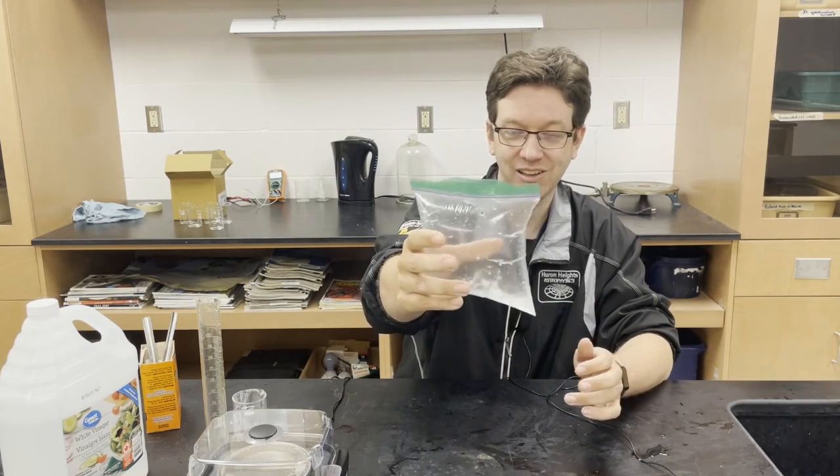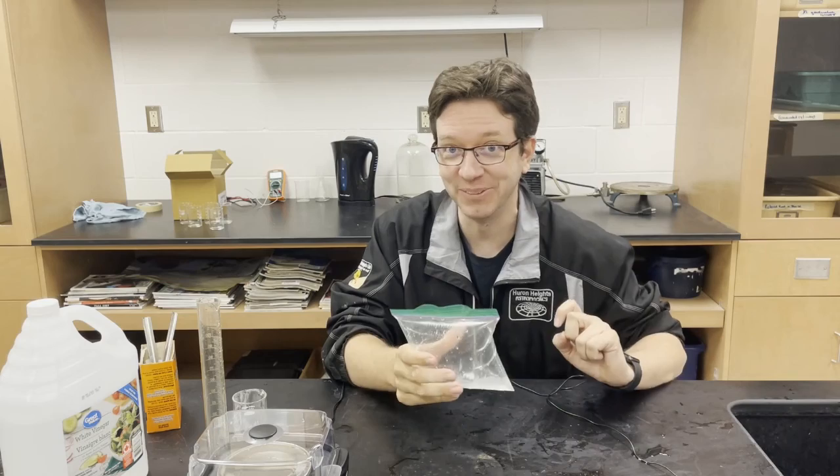And there is our bag of gas that didn't explode this time.